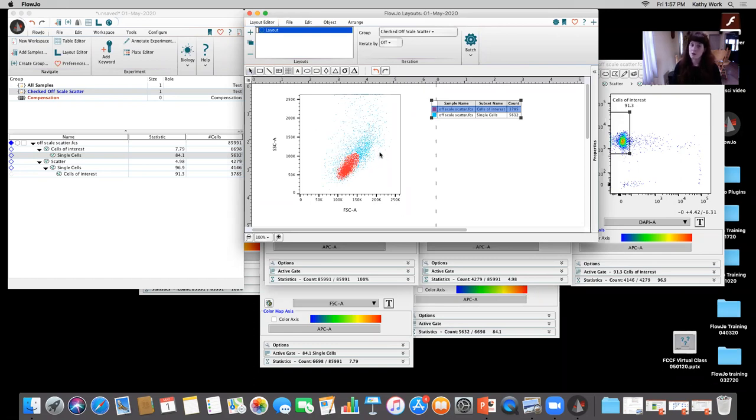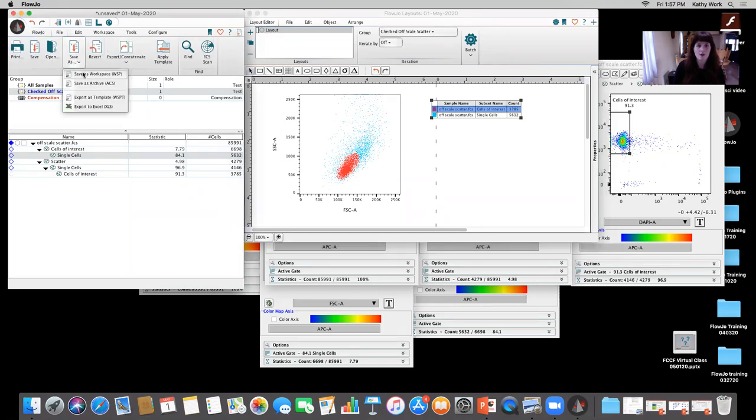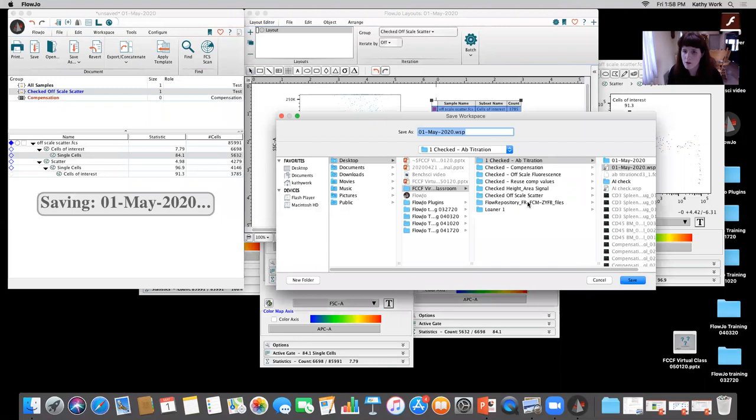So you have all of these cells that are pulling out that the user, or the researcher rather, went ahead and they were so tight on their gating that they got almost half the amount of cells that they were really looking for. And half is a little exaggeration, but still, every cell is going to be important for certain applications. You have to be very mindful of that, okay? And again, I keep saying this, but I know I'm going fast through some things. It's because we reviewed these in previous sessions that I highly encourage everyone to take a look at on our website. So I'm going to save that workspace, okay? And then we're going to take a look at some compensation rather.